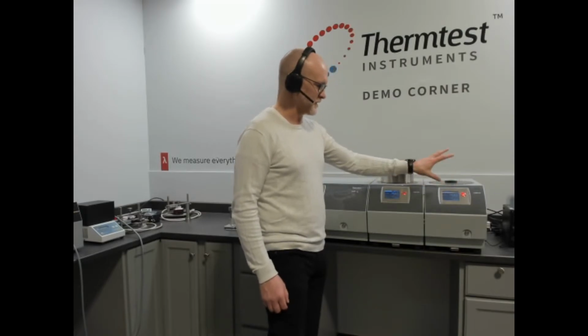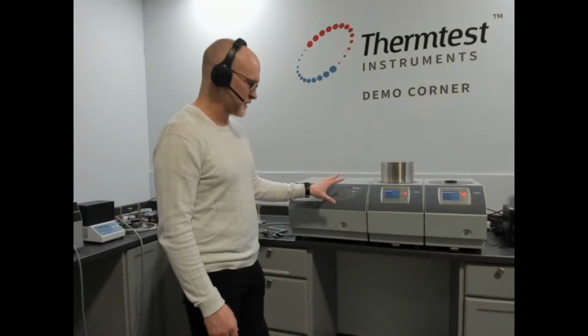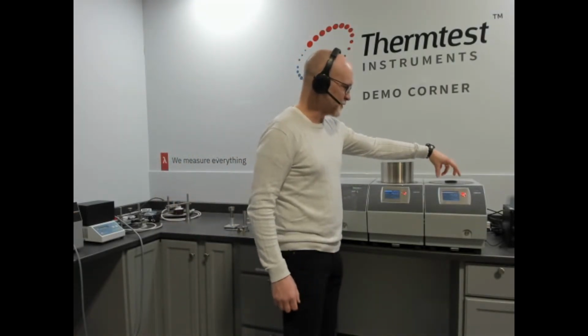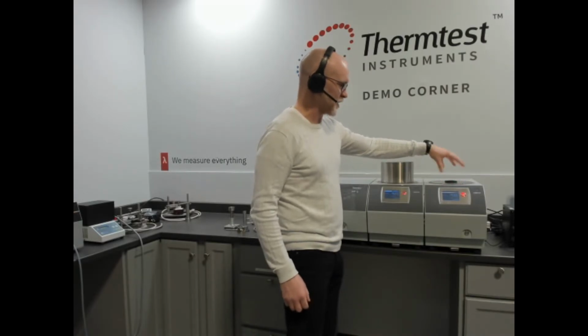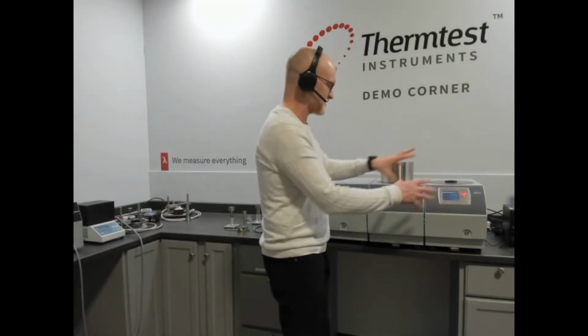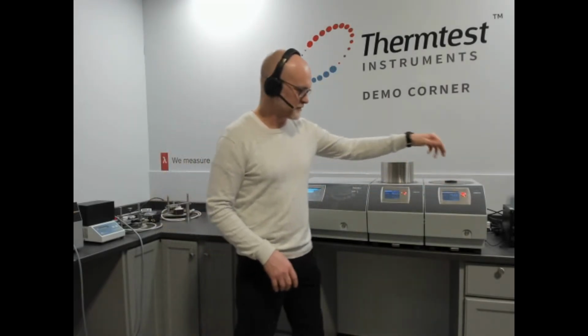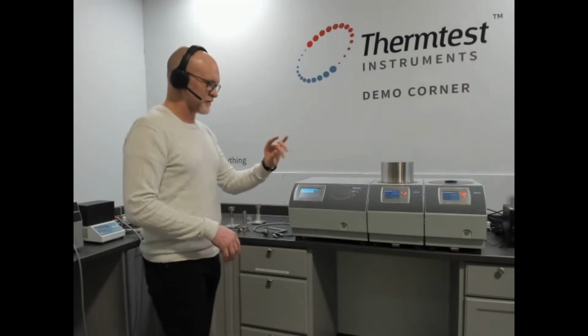This is a unique capability that ThermTest offers within our MP-1: the control of temperature. We have very precise control of temperature because of the proprietary method we've designed. It's all housed, so if you wanted to, you could put 3 or 4 of these next to the controller and you would have a lot of throughput for any of those methods.